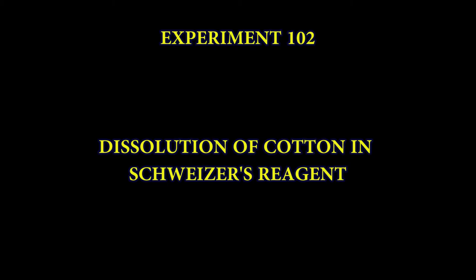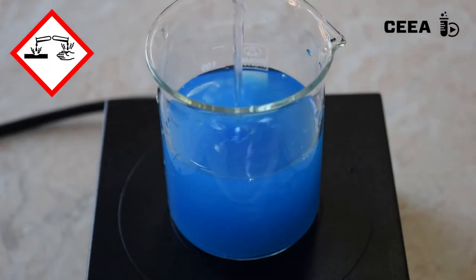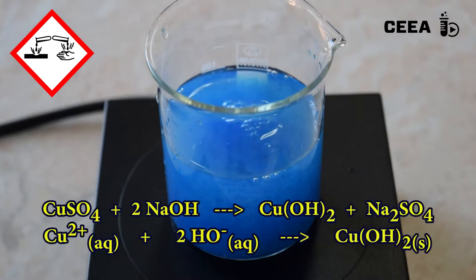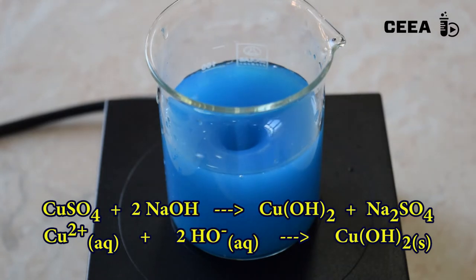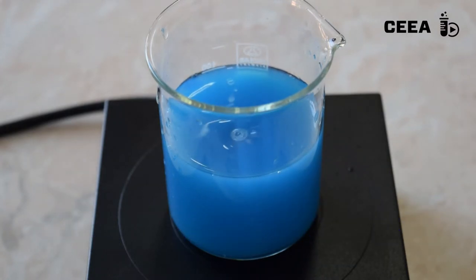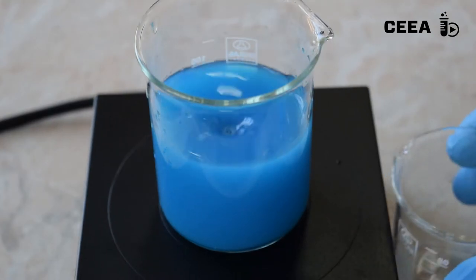Dissolve 5 grams of copper sulfate pentahydrate in 90 ml of solution. Add 0.8 grams of sodium hydroxide and observe the formation of a light blue precipitate of copper hydroxide. Filter off this precipitate in order to discard the sulfate ions remaining in the mother liquor.